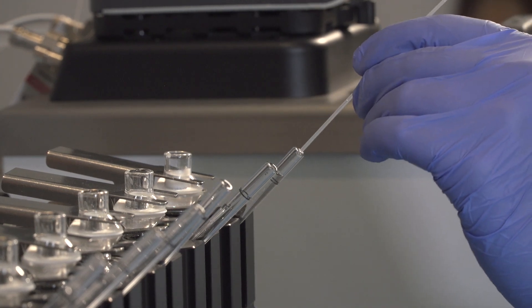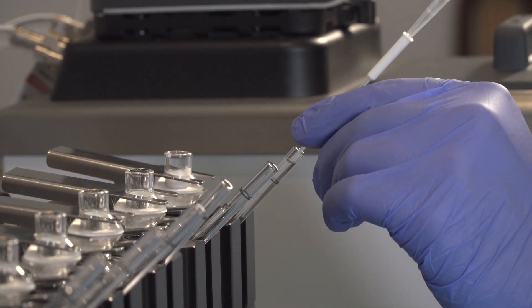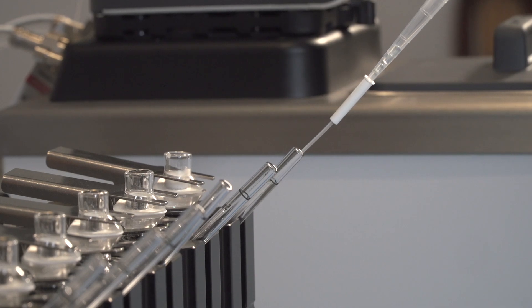For manual systems, the dosage should be applied with an offset to allow for proper sampling. Typically, one minute is sufficient.